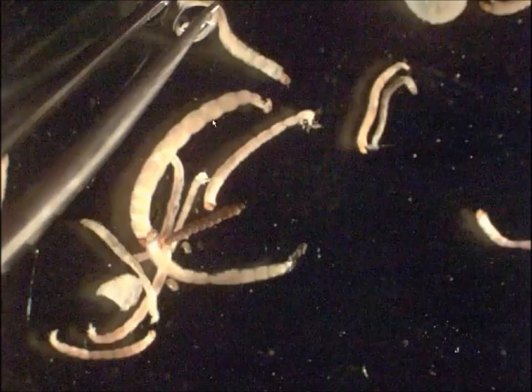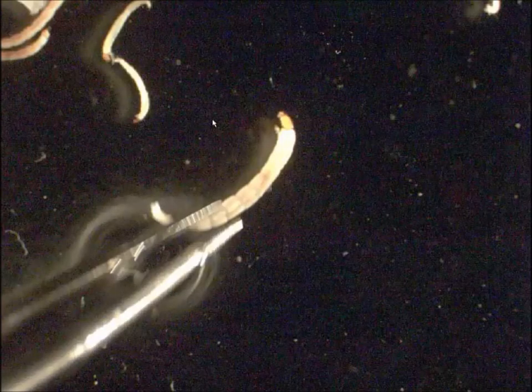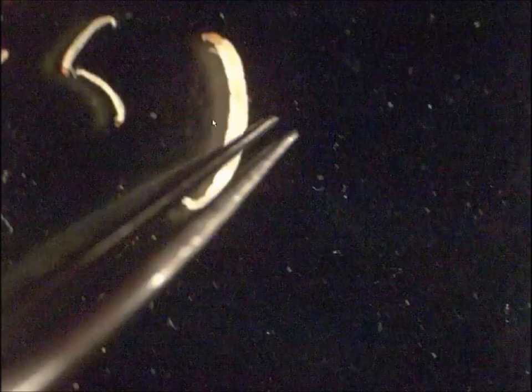You're probably catching on by now that the most difficult part of chironomid taxonomy has nothing to do with the taxonomy itself — it has to do with the fact that these critters are all so small that they're very difficult to manipulate in order to see what you need to see.